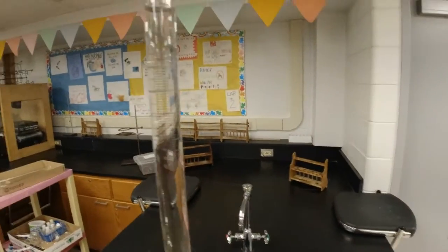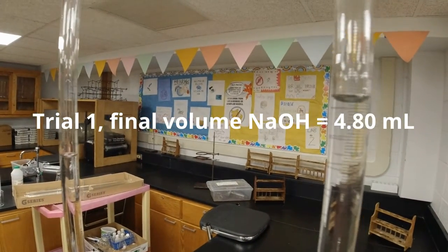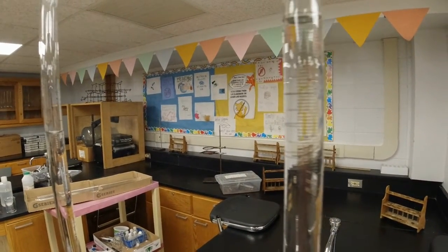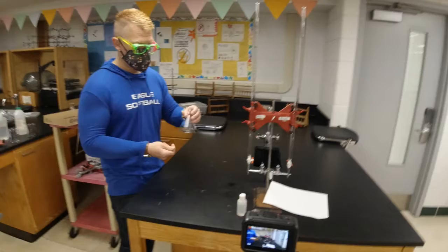So I'm going to go up here. I'm going to read what it says, and it says for the volume 4.80 milliliters. Okay, here we go.